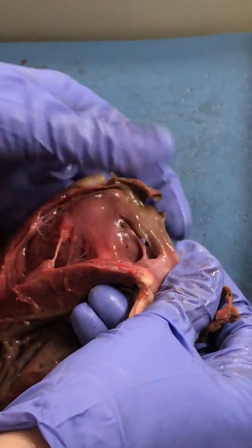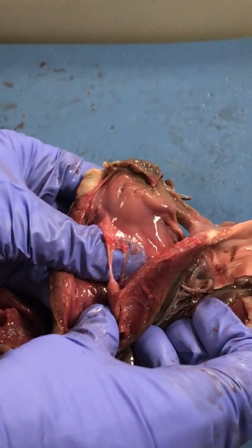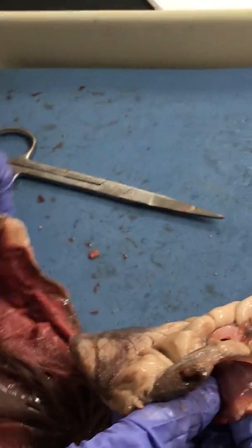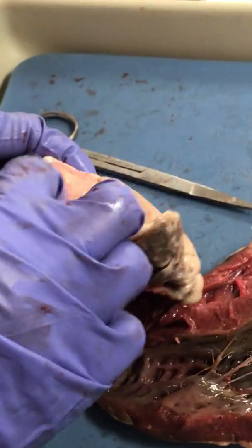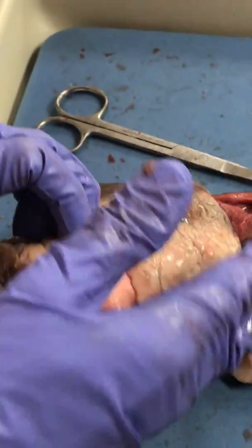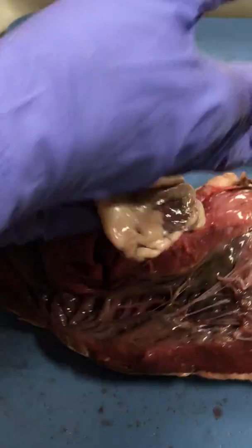Okay? So right atrium, right ventricle, that makes this the right atrioventricular valve. It has chordae tendineae. So the only structure we still need to see then is the pulmonary trunk. That was the aorta, and just anterior to it is the pulmonary trunk. I know it because it's coming out of the right ventricle, which is thin-walled.